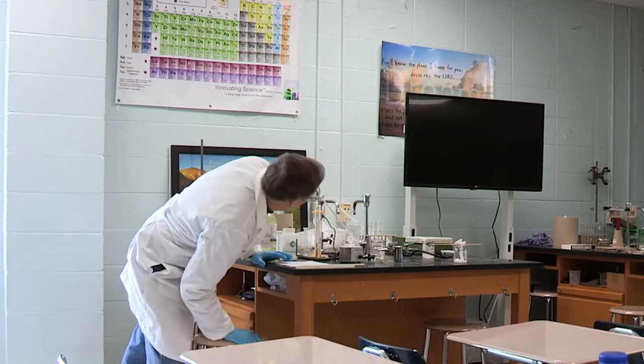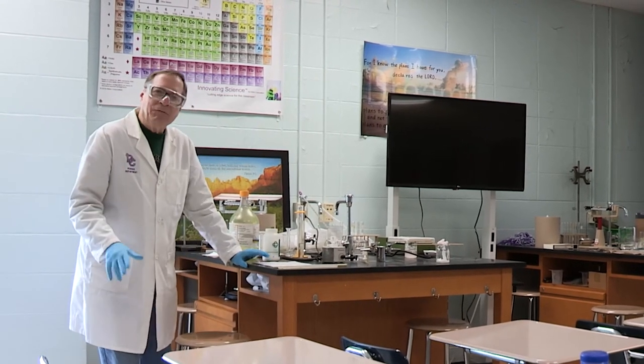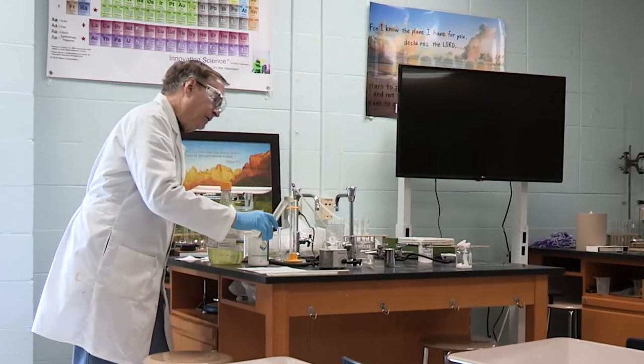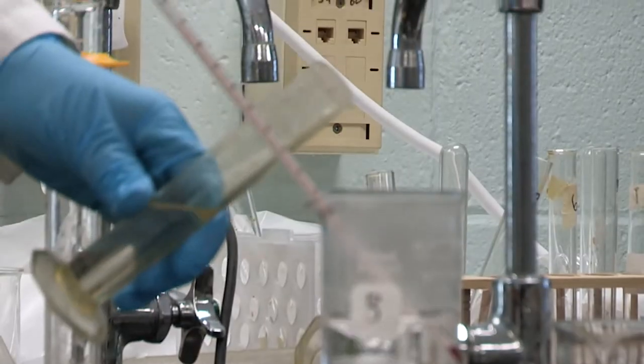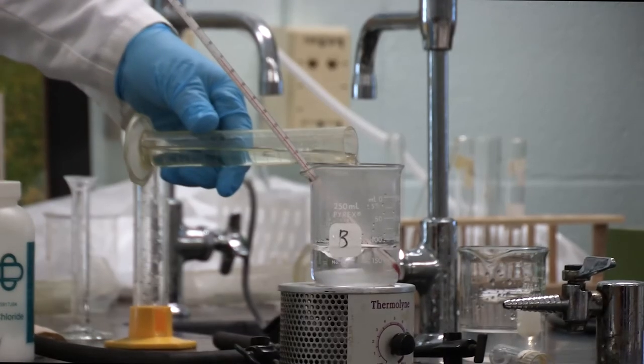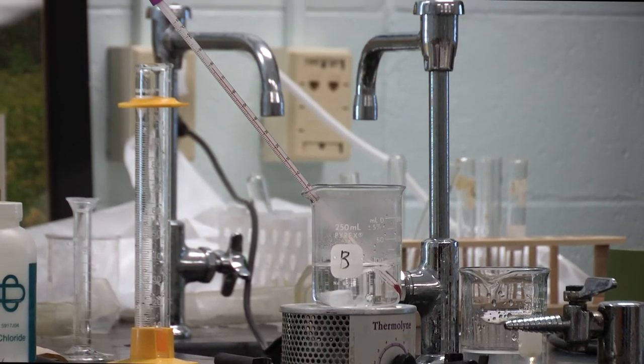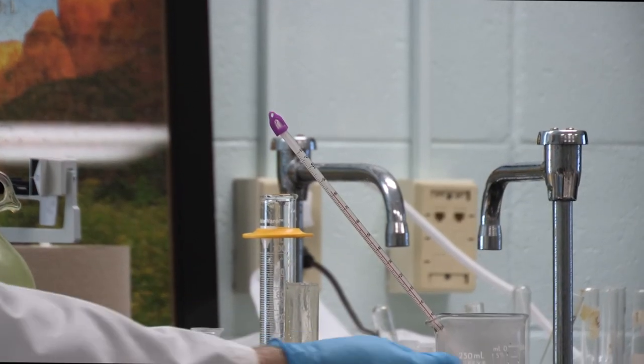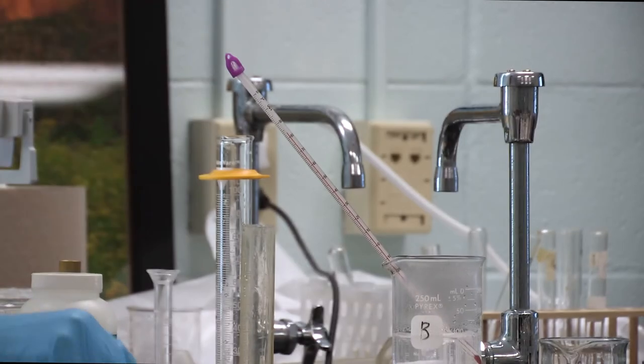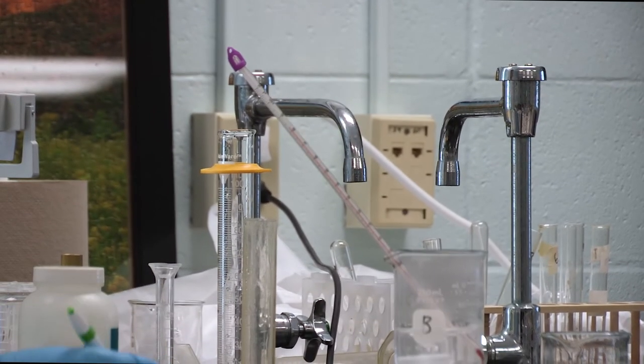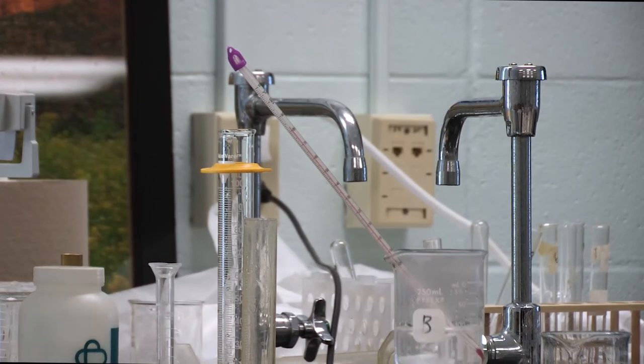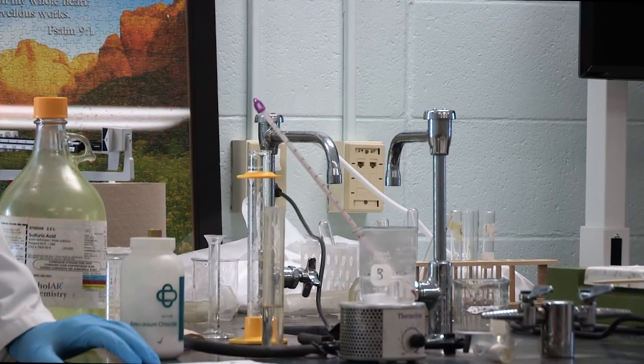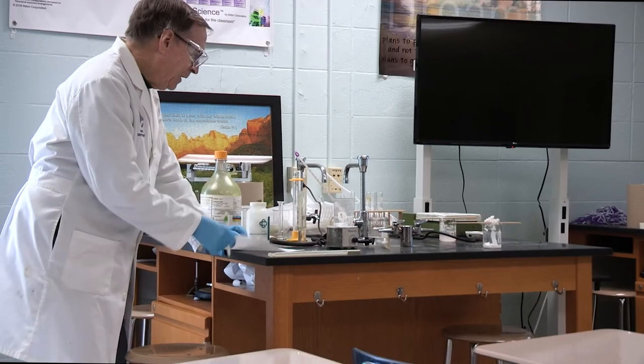I said I think I can make it boil. We're almost up to 70. I have to get up to 30 more degrees. Instead of 5, let's do another 10. I can still see steam coming out. Here's another 10 milliliters. See the steam coming out? Can you see the condensation on the inside of the beaker? I'm going to call it 83. So it went up another 11 degrees. We've gone from 14 to 83. That's 69 degrees already.